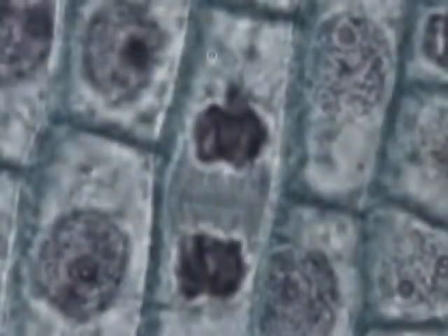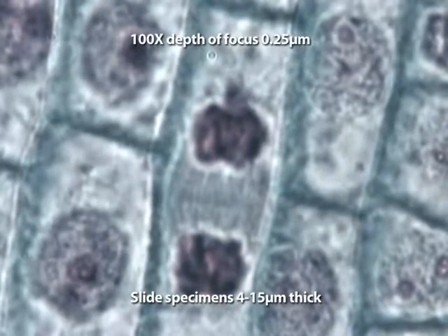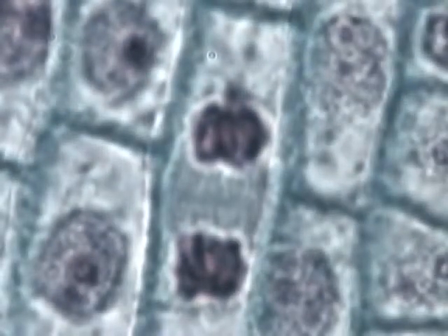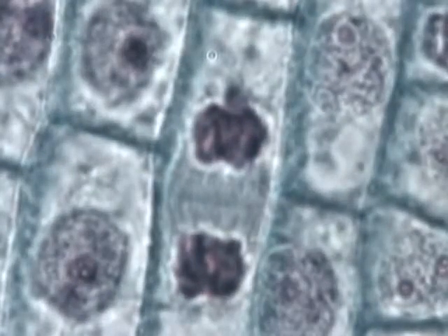With increased magnification, the depth of focus decreases. As many sections of specimens are 4 to 15 micrometers thick, and 100 power lenses only have a depth of focus of 0.25 micrometers, the top and bottom of the specimen cannot be in focus at one time. You have to keep continuously moving the fine focus knob to see the specimen completely.